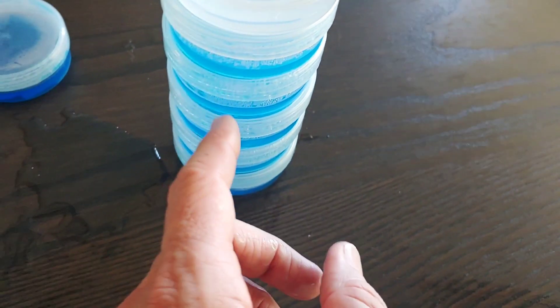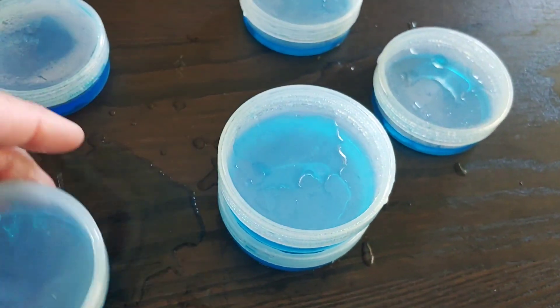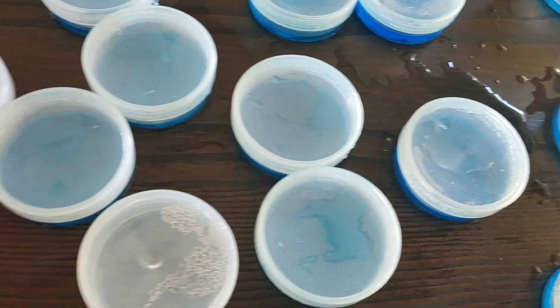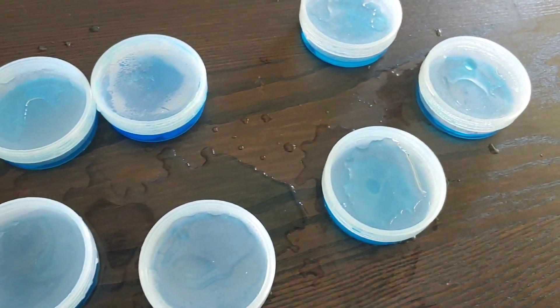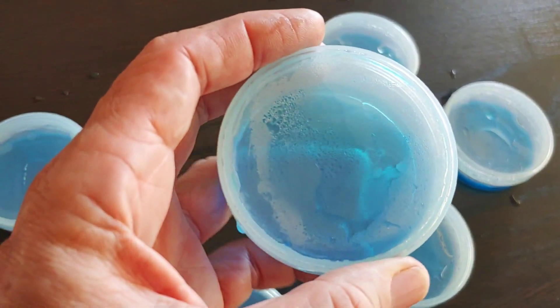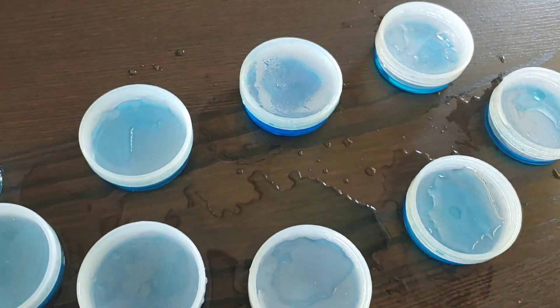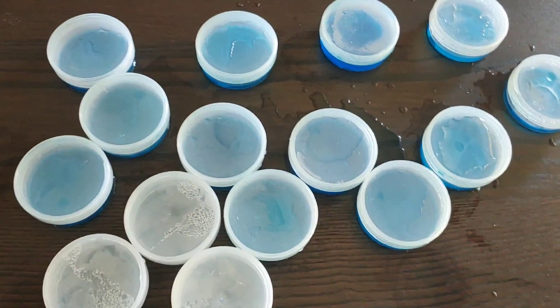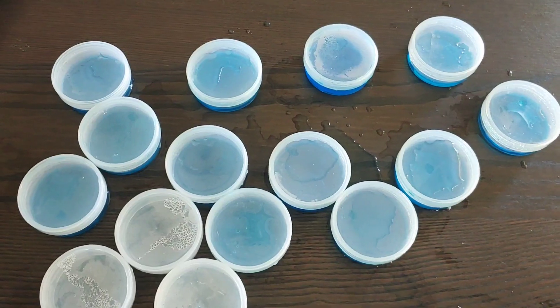Now the tower — this one has one, two, three, four — it's good all the way down. You can see the top ones still have condensation, and all the other stacks, even four up, don't. I don't know why this one didn't remove the condensation even though it had water. But out of 12, just one still has condensation. That's pretty good results. So I'm going to post this video so you guys know what the new developments are. Very cool — we have beaten the condensation problem.